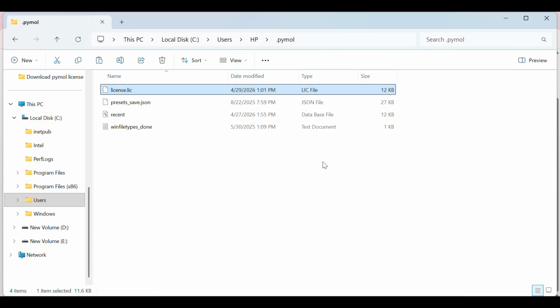Place the license file in the PyMOL installation folder. Here you can see it is in the C disk. You just copy the license file and just paste in this folder. That's how you can download and activate a PyMOL academic license step by step.